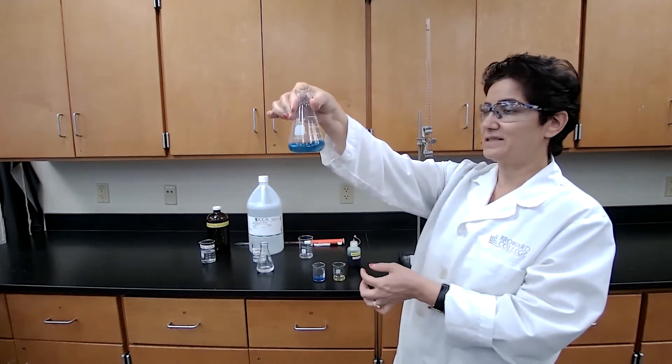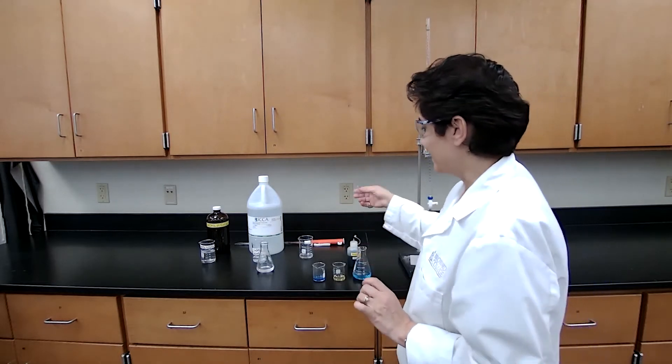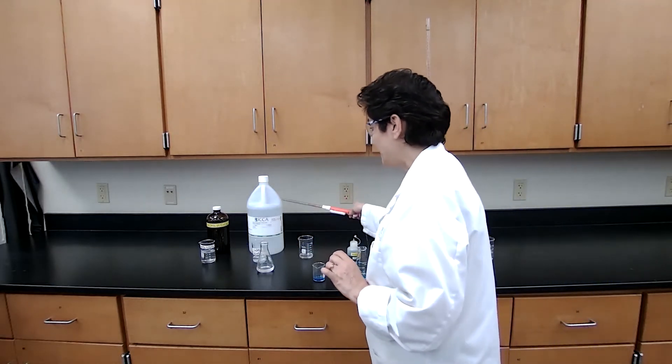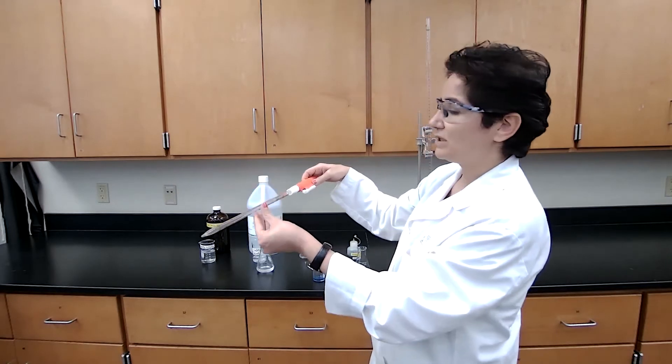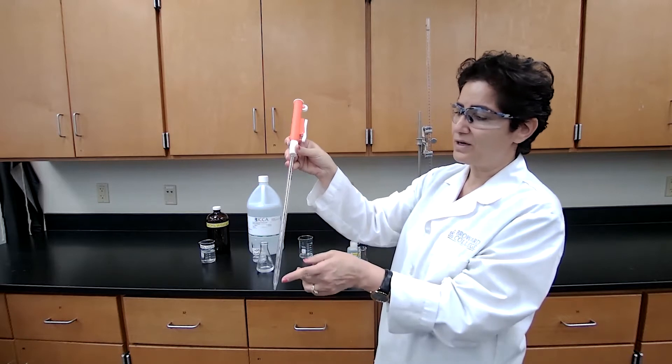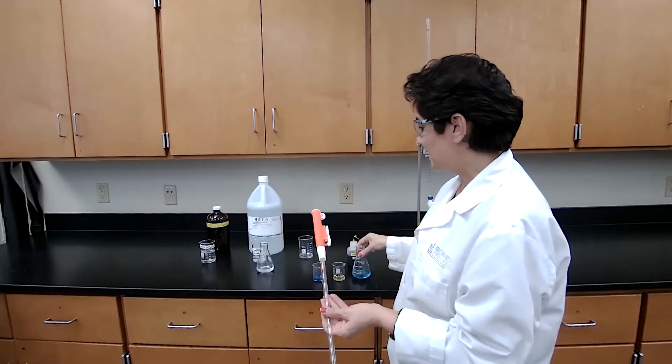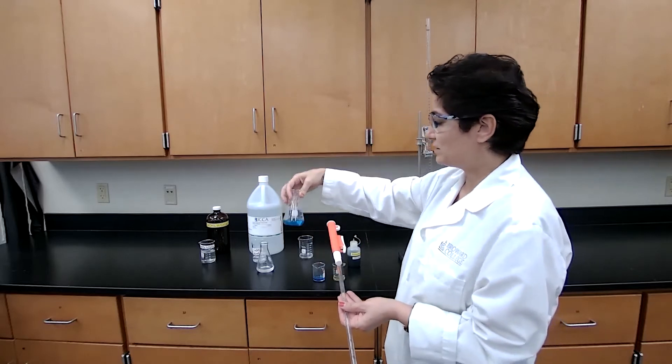I have a nice blue color here for the basic solution. I just want to add that I use pipette. But since you already used pipette and you have the explanation, I will show you how to use it.